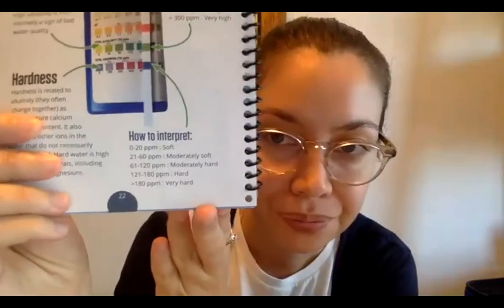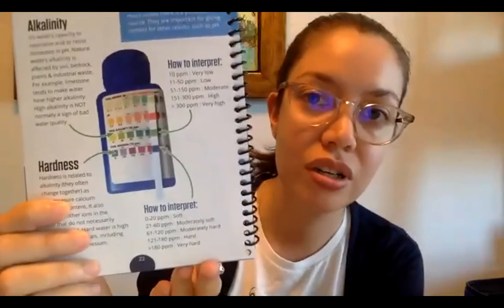I feel like I didn't say the normal values for hardness. I can find this for you. So for alkalinity and hardness, we have these normal values in here. All that information is in your little guide, and also on the website. If you ever don't know what something means, there's always a little question mark next to everything, and you can click it and it's going to give you some little diagrams and useful information about what to look out for. Let me see if I missed anything.